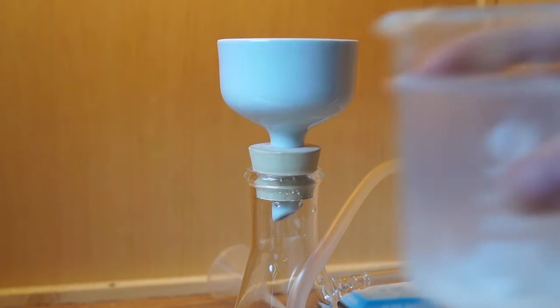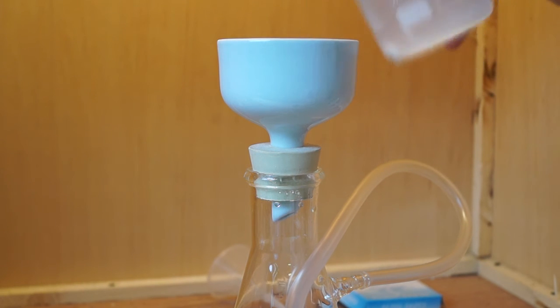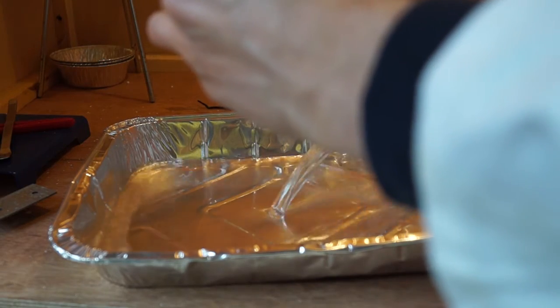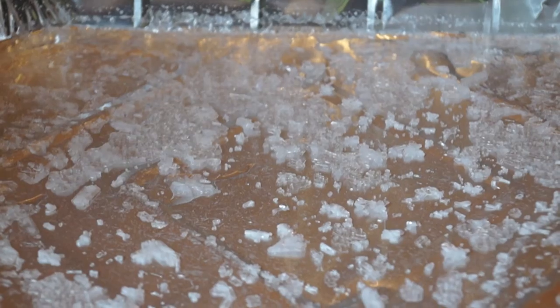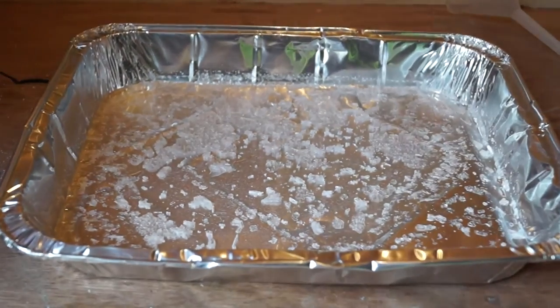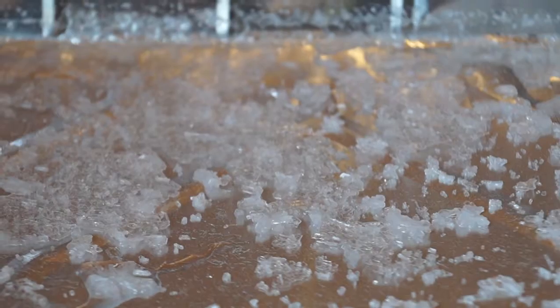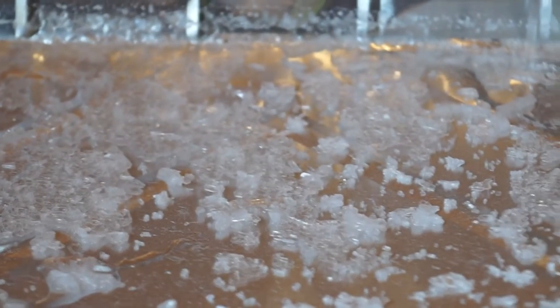I then proceeded to vacuum filter the solution and poured it into a tray and left it overnight for the solvent to evaporate away. I returned to find that all of the solvent had evaporated and pure aspirin crystals remained on the surface of the tray, which I then crushed into a powder using a pestle and mortar.